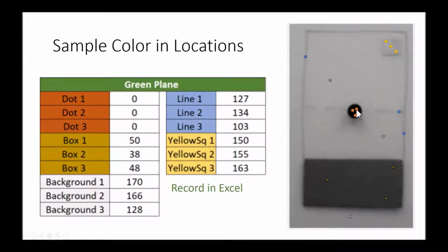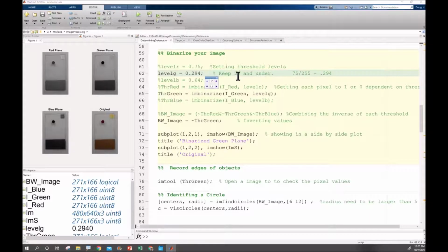Take readings from multiple locations within the image and record them down in hopes of setting a good threshold for this image. Knowing that everything I need to keep is below 50 and everything I need to get rid of is over 100, I'm going to start my threshold at 75 and divide it by 255, which is my full range of color, giving me 0.294 as where my threshold needs to start.